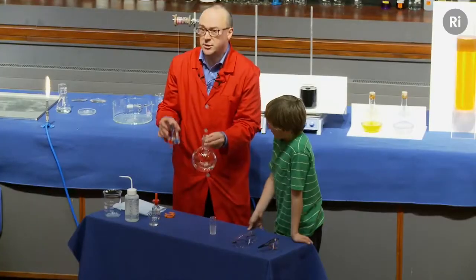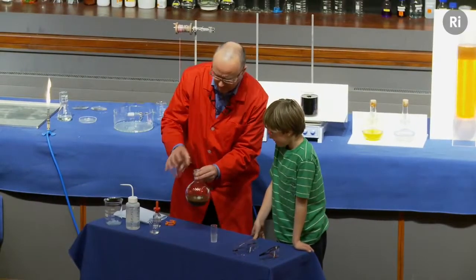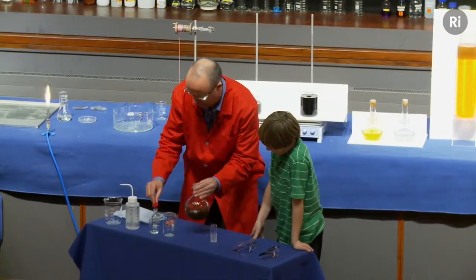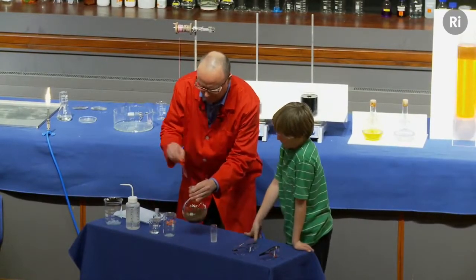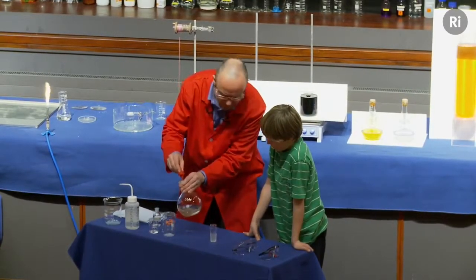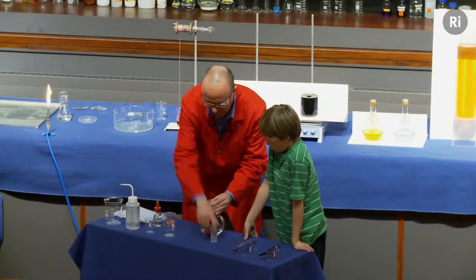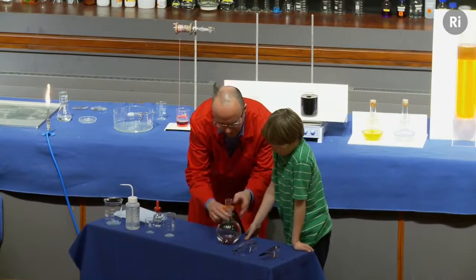Now what I'm going to do is to add some sodium hydroxide. That's now formed a sort of very dark brown, almost a black material. So I'm now going to add more ammonia. And again, I'm going to add ammonia until the liquid goes back to being colourless. This takes a moment or two. There we go. And then finally, I'm going to add some glucose. So there's the glucose. Now I'm going to put the lid on, put a clip on. I'm going to give it to you, Dylan, and I want you to hold that.